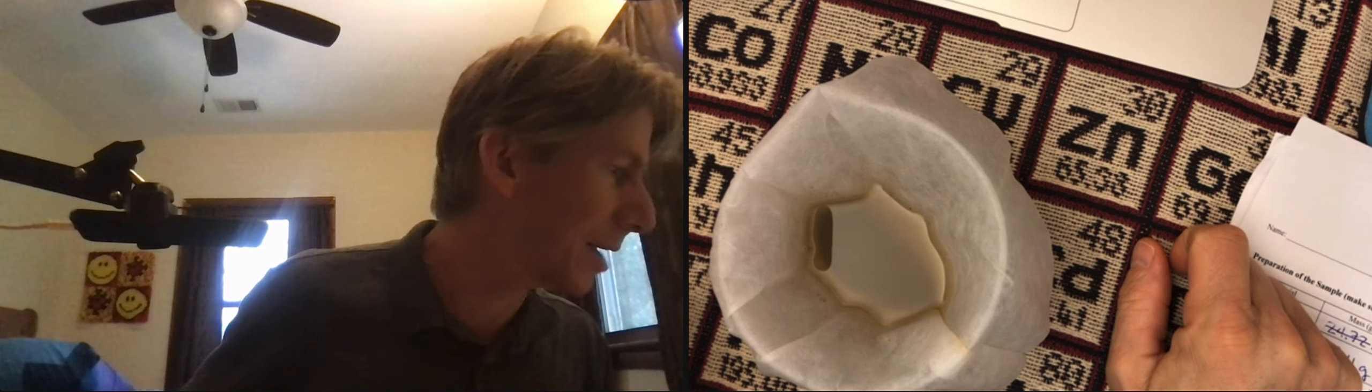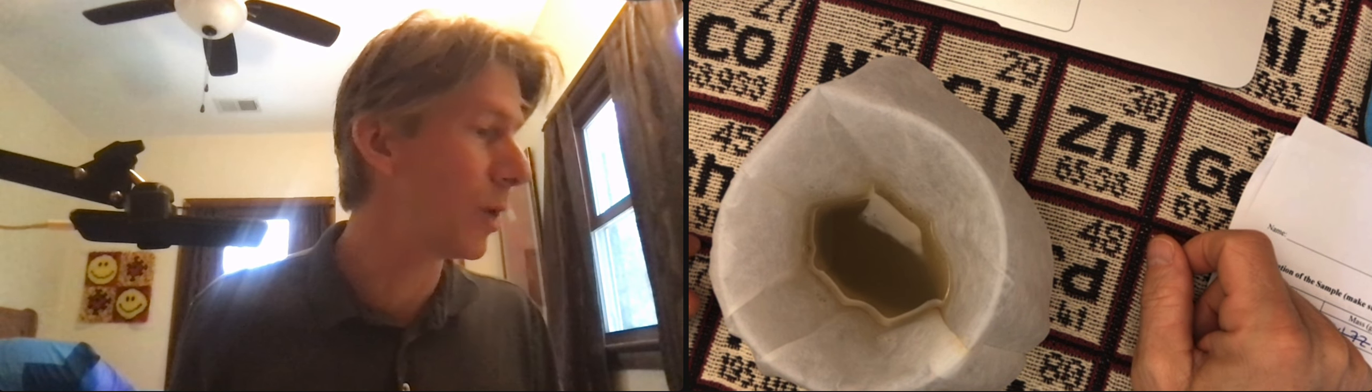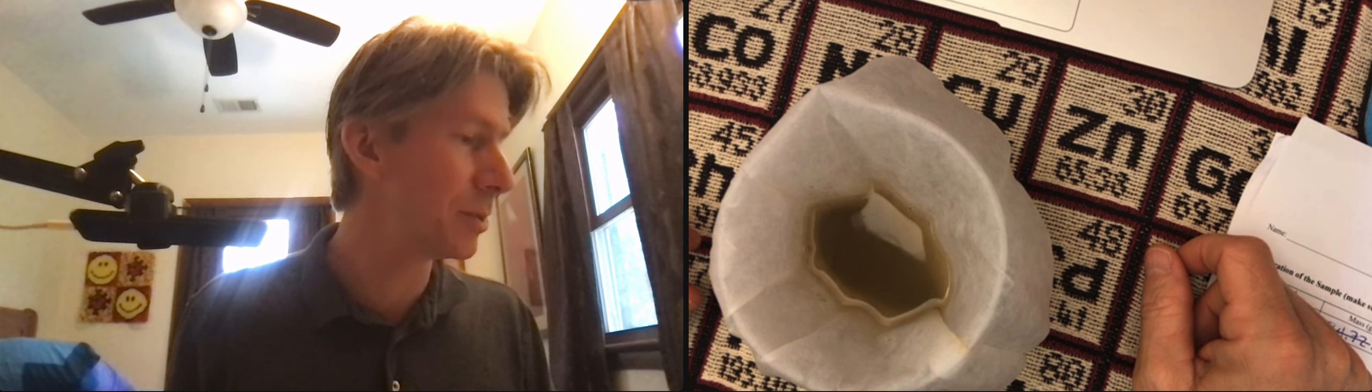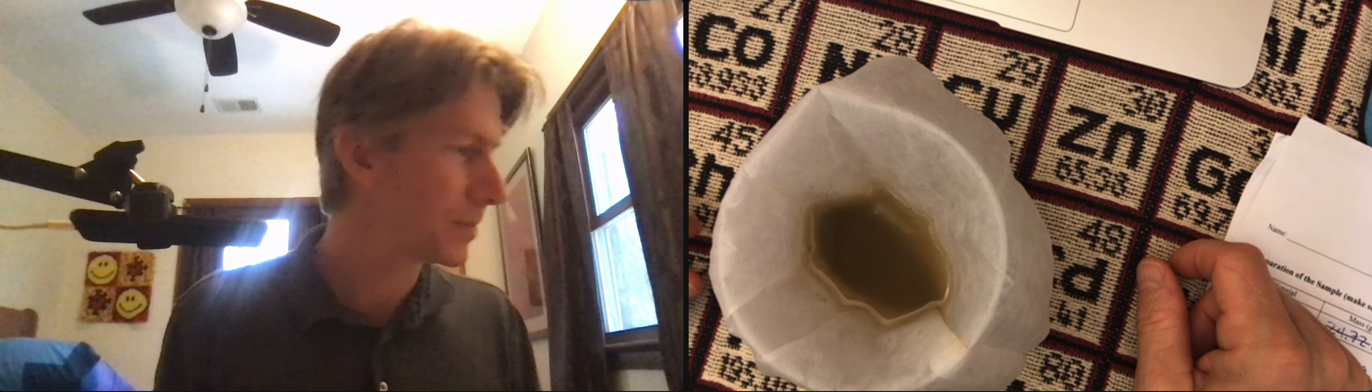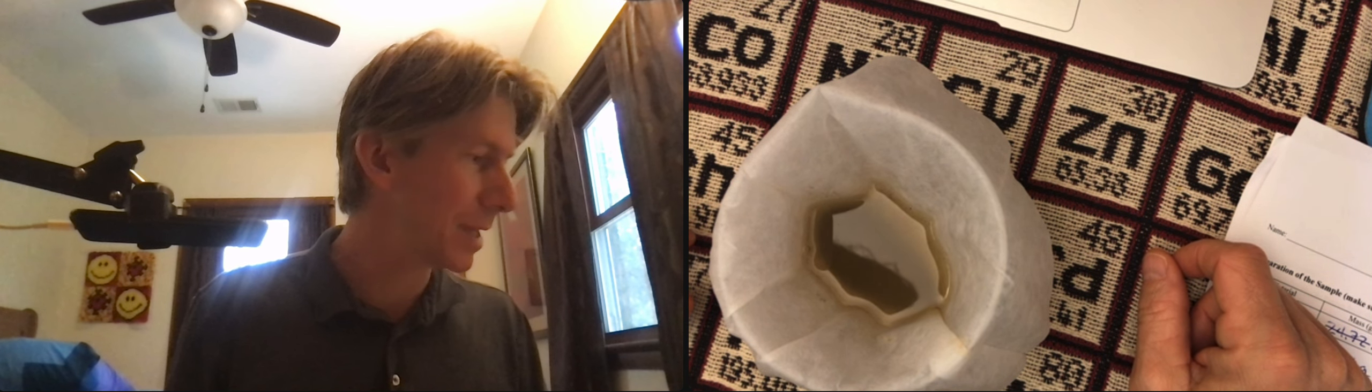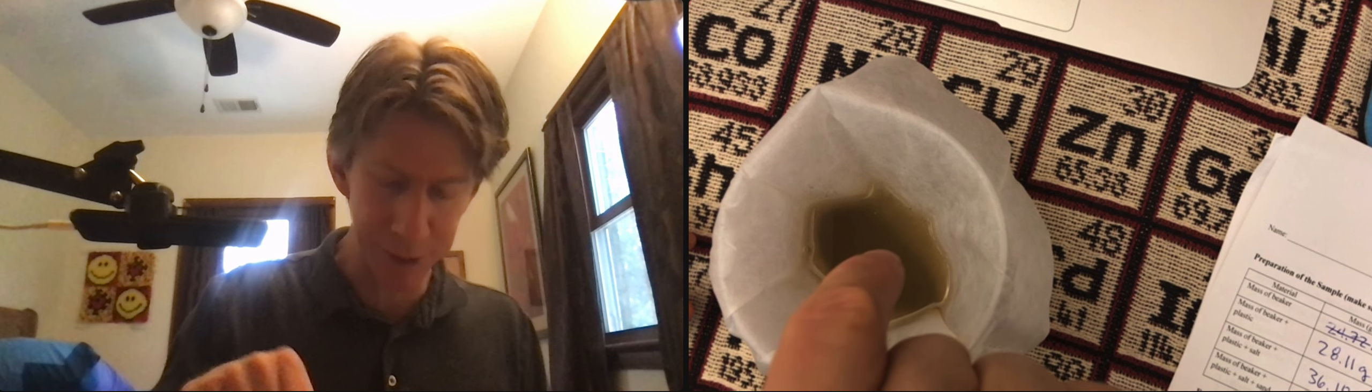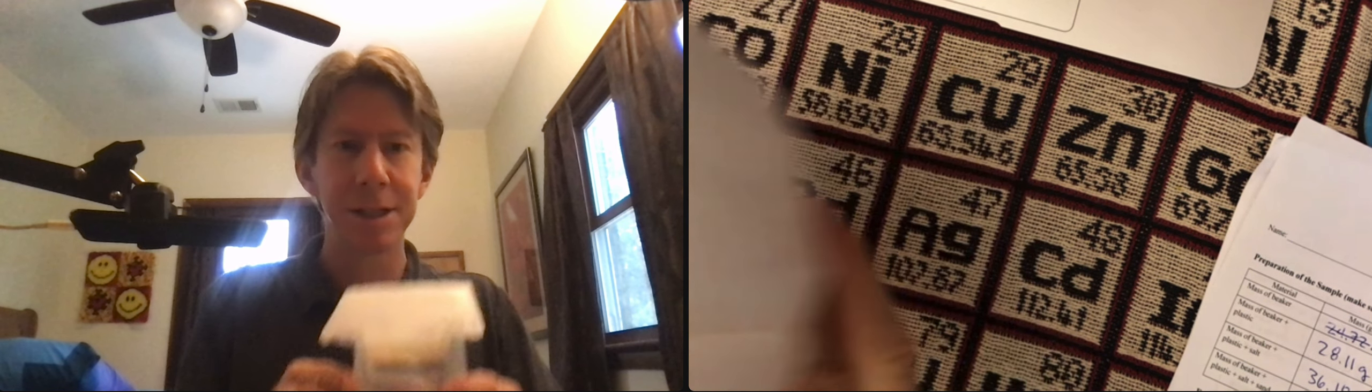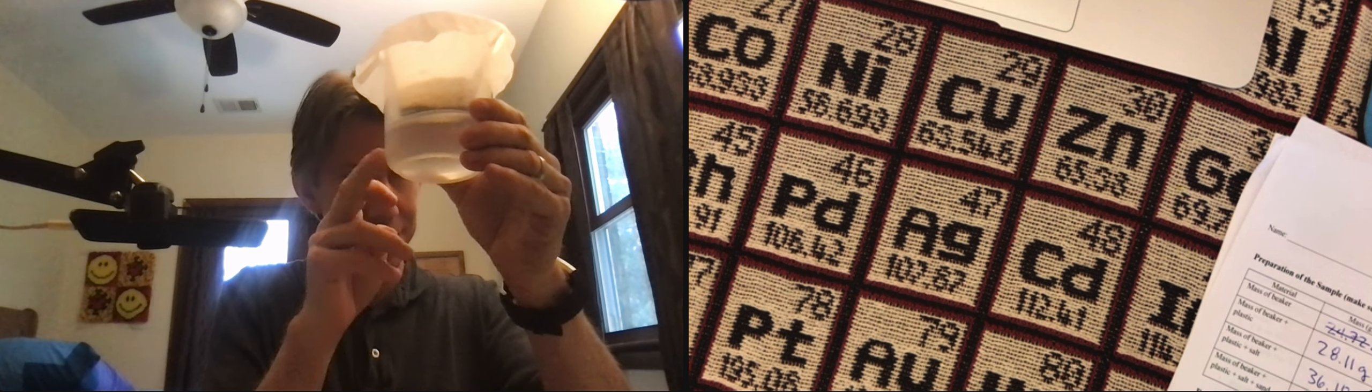And pretty much the next step, allow the filter paper to drain for a minimum of one hour until there is no visible solution in the filter paper. And at this point, the sand will be in the filter paper and the salt will be dissolved in the water down below.